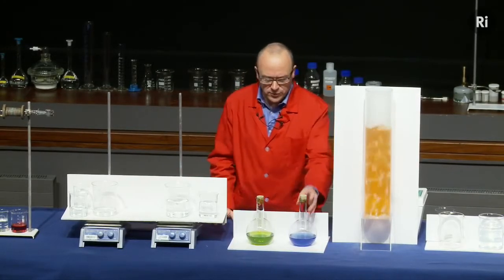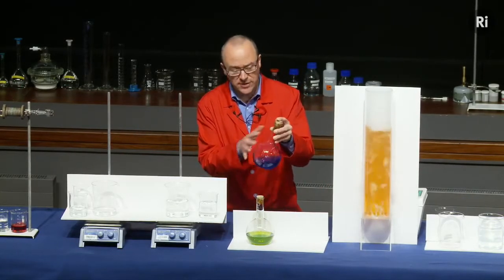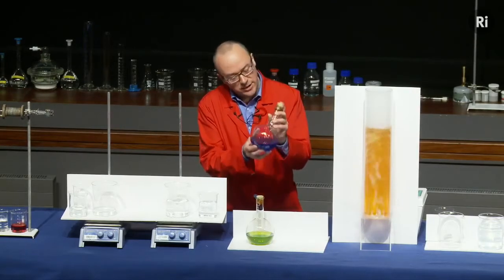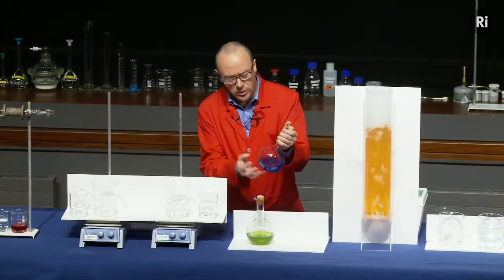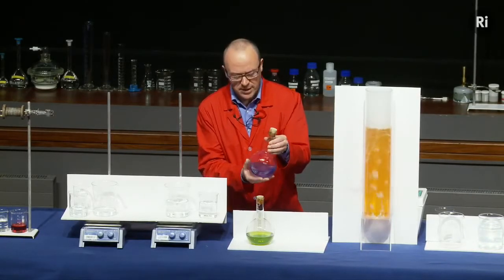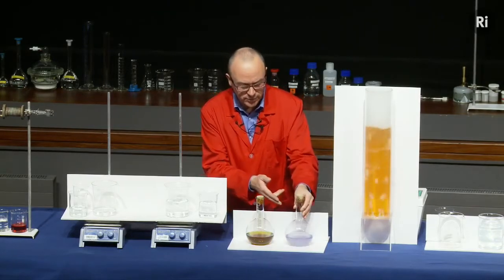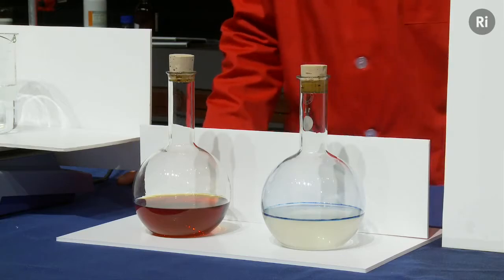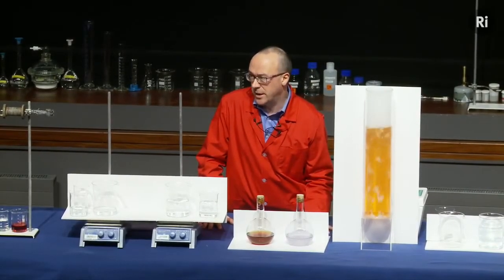What we have to remember, of course, is that this flask not only contains water, but it contains a gas. In fact, the gas is just air. And air, of course, is a chemical. And when I shake the flask, I'm mixing oxygen from the air with the liquid, and that's producing the chemical reaction. So the next question is, did this chemical reaction then go backwards as it fades from blue to colourless? Is it a chemical reaction that's going backwards? Well, unfortunately, it isn't, because what's happening is there's a second chemical reaction taking place.